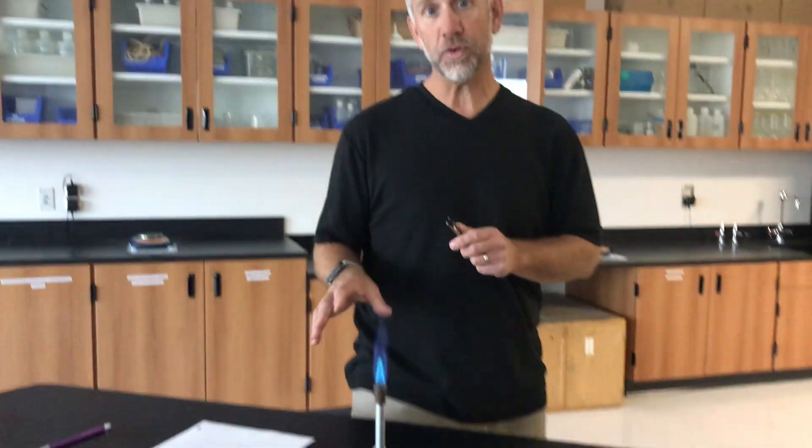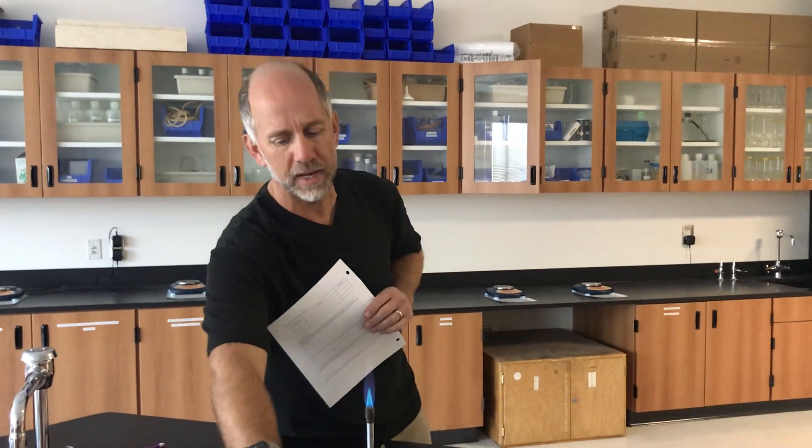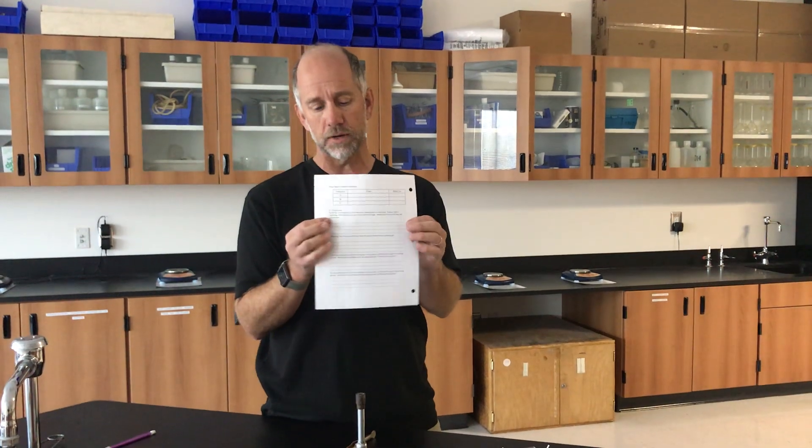Feel free to stop and rewind and move around in this video as you need to do your comparisons. We will be grading your identity of the ions that you identified in your unknowns and then all of the conclusion questions. Please be careful as you answer these conclusion questions — the answers and concepts you need can be found in the pre-lab discussion. If you haven't yet, go back and reference that, then fill out the conclusion questions on the lab. When you come back to school, you'll be turning this lab in to your teacher. This will be due as soon as you return, so fill it all out and be ready. Good luck with the write-up.